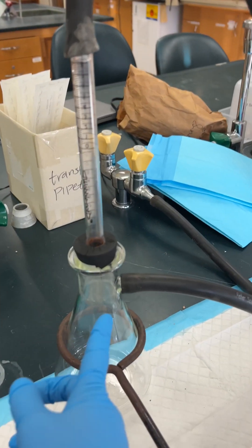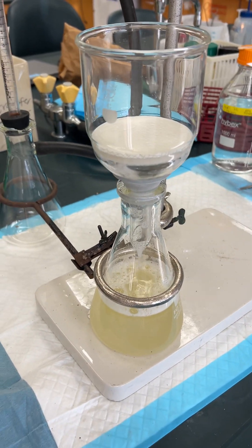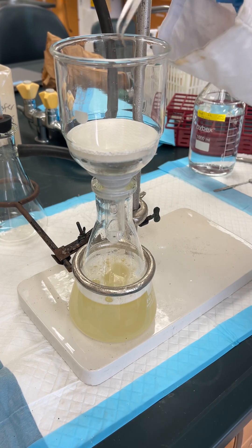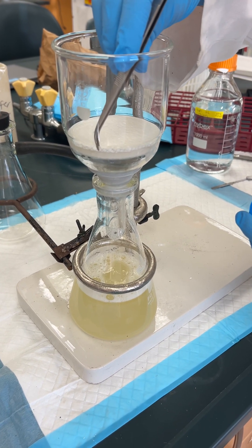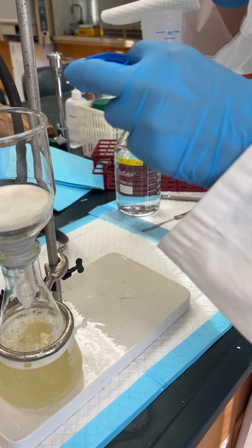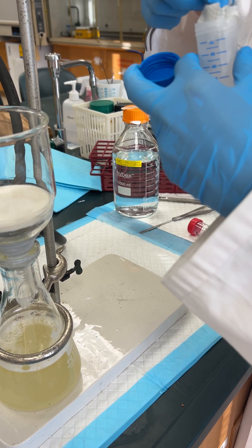This is just the vacuum trap to keep it so that nothing gets sucked in. And then we take the filter paper — this is kind of the hard part — get it into there, then you're just going to dump it into the liquid nitrogen down here and then put the cap on and then put it into our liquid nitrogen.